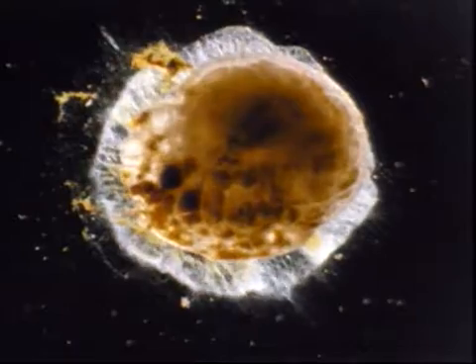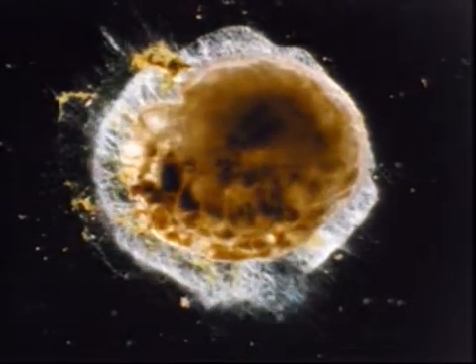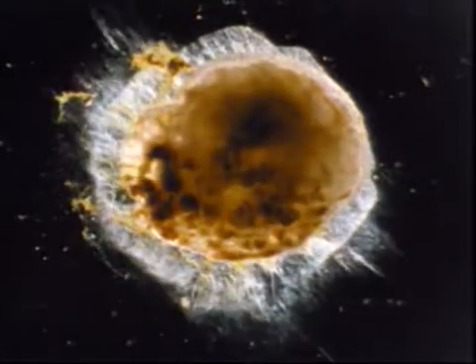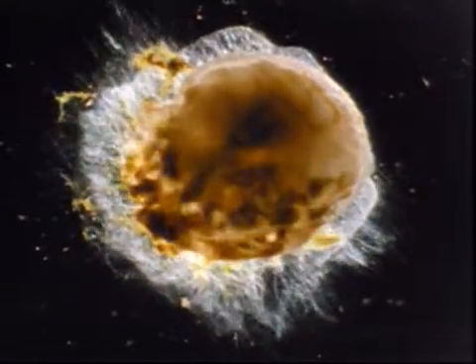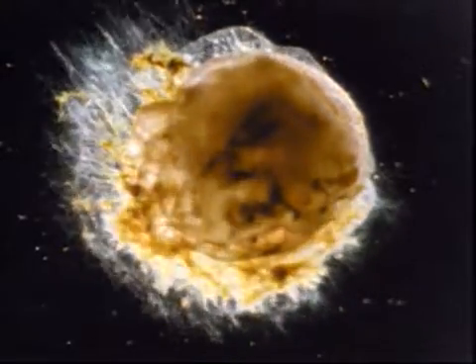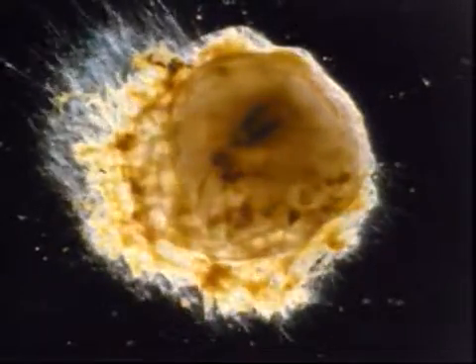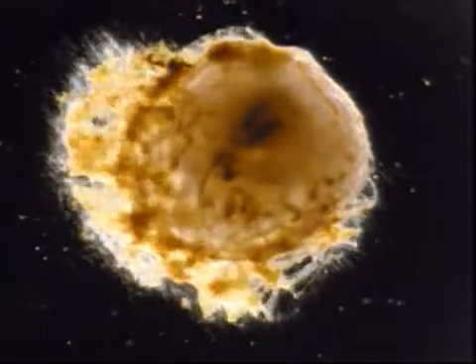The protoplasm, with its symbionts, emerges from the test by the many openings of the canal system, which connects the test lumen with the ambient medium. The coloured protoplasm is flowing in criss-cross streams on the empty calcareous test.